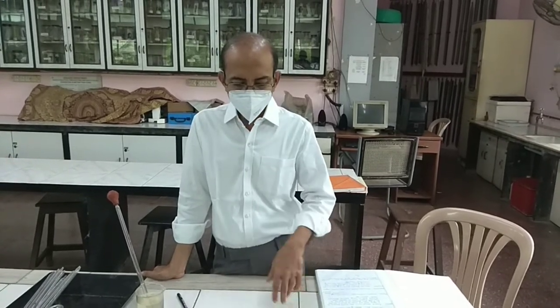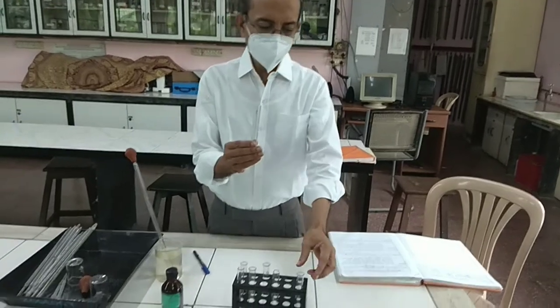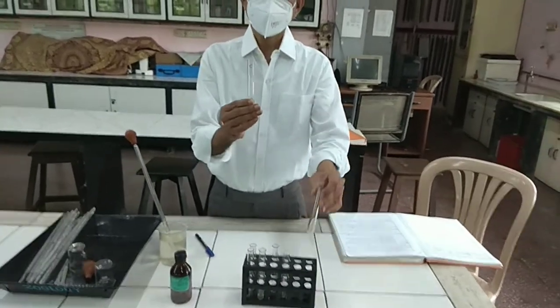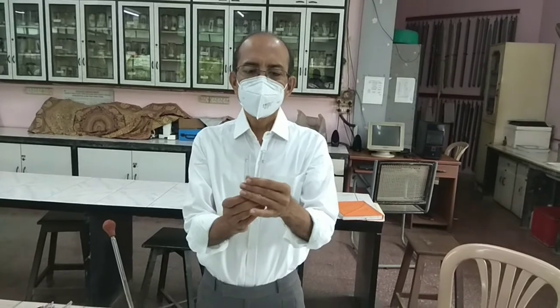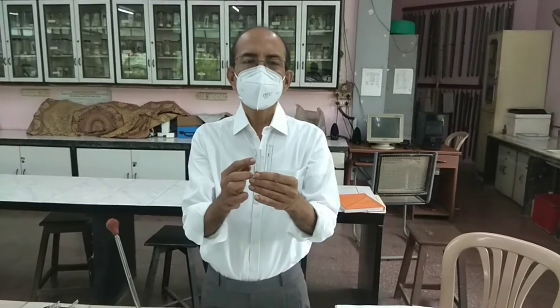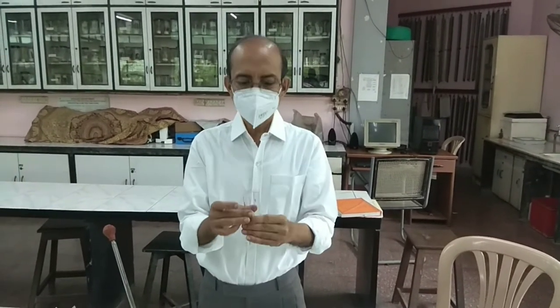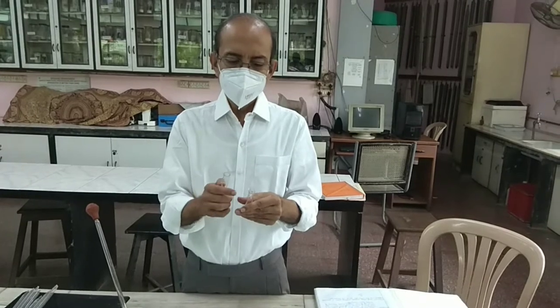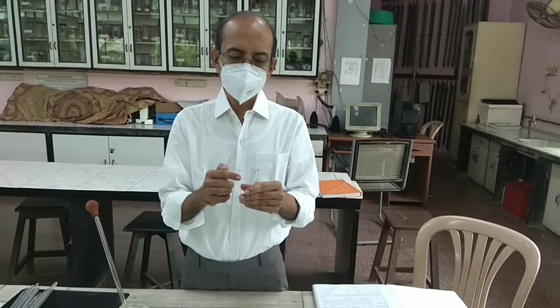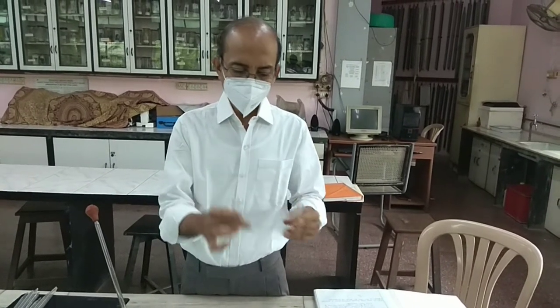In order to prove this, we will take two test tubes. One is labeled C and the other E. C is for control and E is for experimenting. We will take three ml of distilled water in C and three ml of pond water in E.